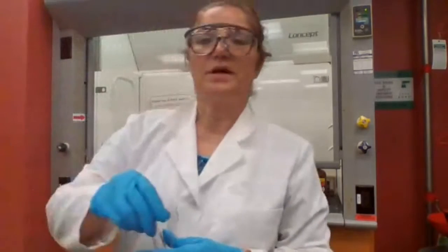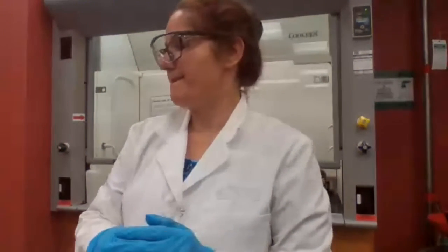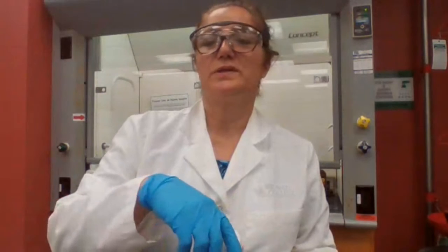Is phenol soluble in water? Because the first test for phenol is solubility. Would it dissolve in water? Yes or no?